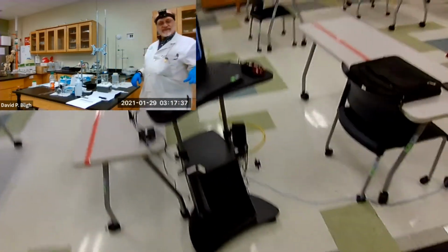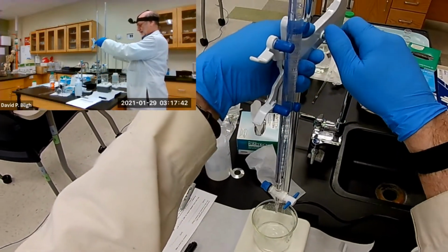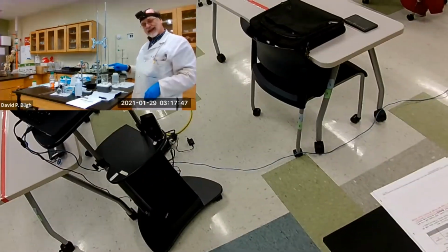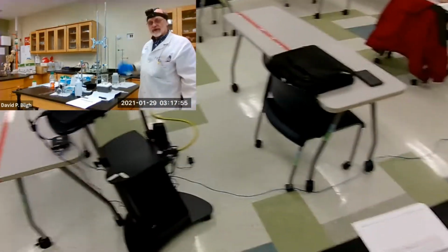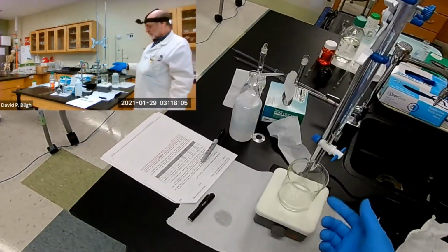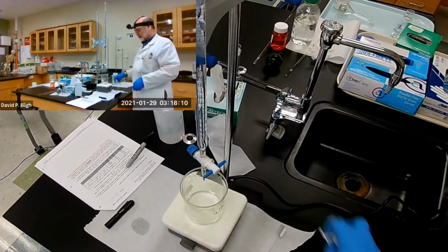So why was that not a bad thing? Well, remember on previous titrations, I mentioned you got to get rid of any air bubbles in the tip of your burette. That burette was open, so it was blowing through there with maximum force and speed, and it blew out any air bubbles that were left. So I wasted some reagent, yes, but I got rid of the air bubbles. So that step is done for me.